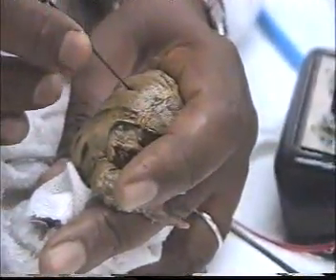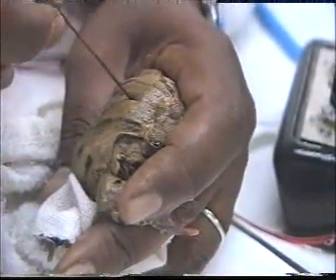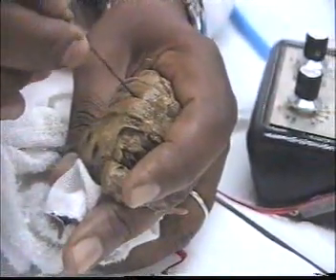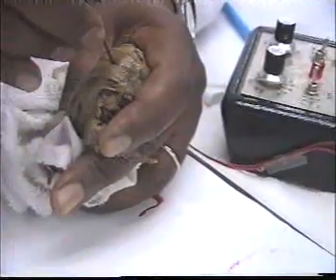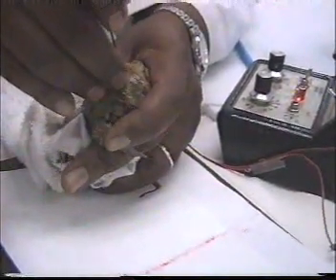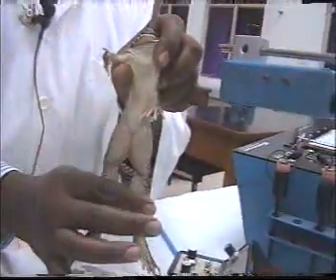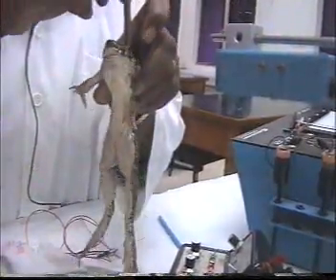At the junction between the first cervical vertebra and the skull, there is a depression. If we push the needle forward, it's going to destroy the brain, and if we push it backwards, it's going to destroy the medulla oblongata and the spinal cord. So first you press, then you push. When the needle is on the right track, the frog will be paralyzed. You push the needle inside, and you see the legs are paralyzed. It's an indication that the medulla oblongata is destroyed.